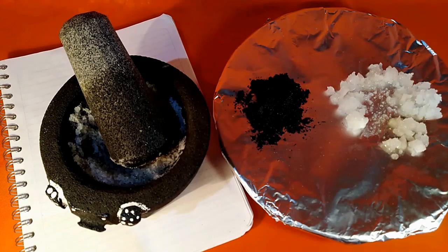And you might remember at the very beginning of the experiment, I had measured out 60 grams of sand, 40 grams of salt. Now, I had never showed you drying that 100 grams of material. It was, in fact, not dry. So it may have turned out that there was some water weight included in that experiment, and I'll just kind of leave that for you to think about, whether it was the sand, the salt that might have had some water content at the beginning of the experiment that wasn't accounted for, and if we could maybe estimate how much water there was at the beginning.